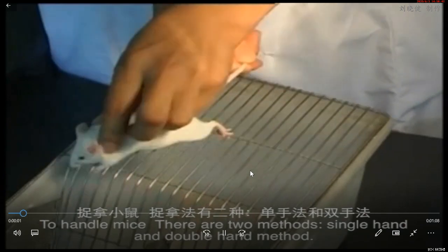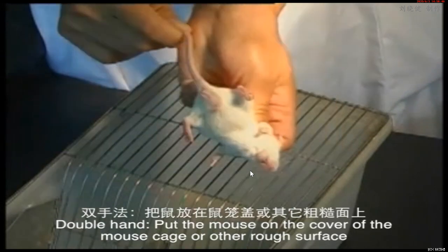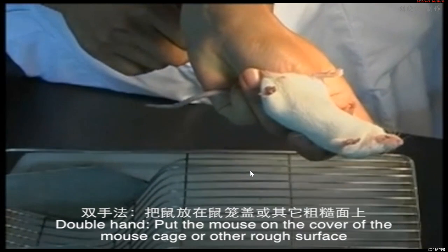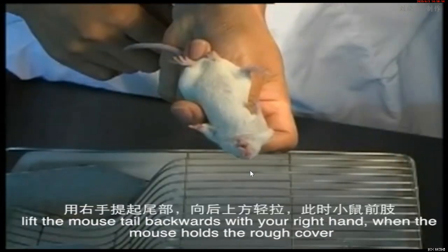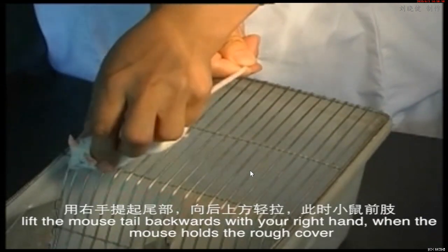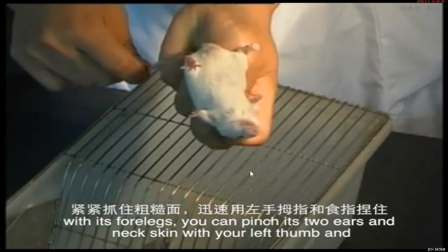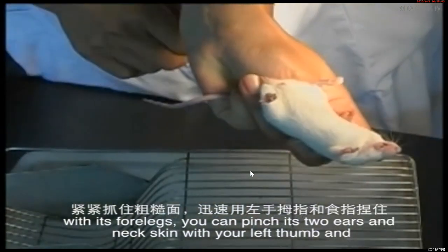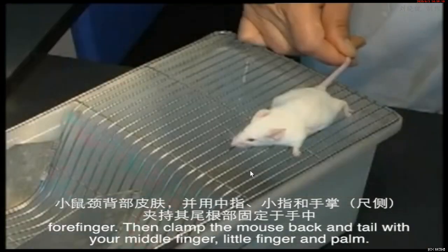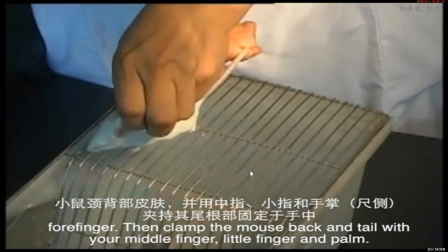There are 2 methods, single hand and double hand method. Double hand. Put the mouse on the cover of the mouse cage or other rough surface. Lift the mouse tail backwards with your right hand. When the mouse holds the rough cover with its forelegs, you can pinch its 2 ears and neck skin with your left thumb and forefinger. And then clamp the mouse back and tail with your middle finger, little finger, and palm.